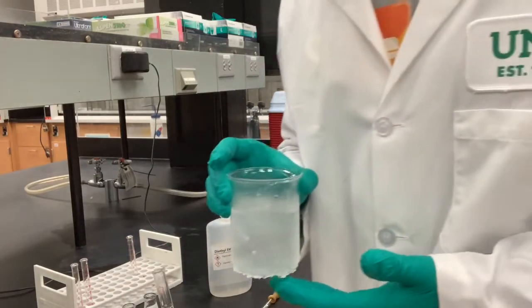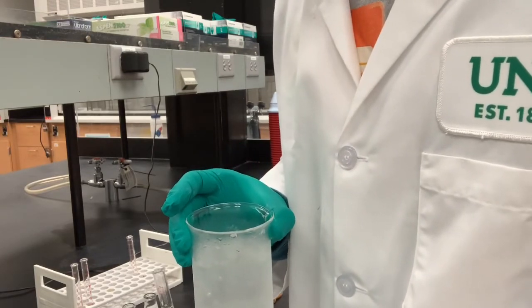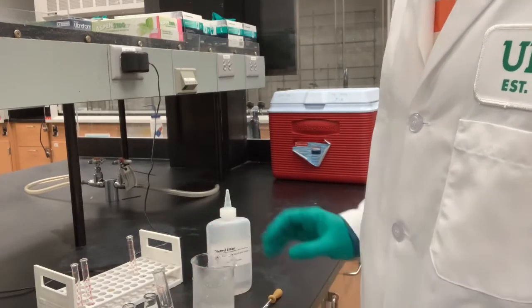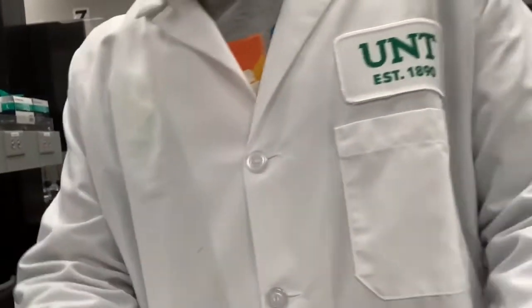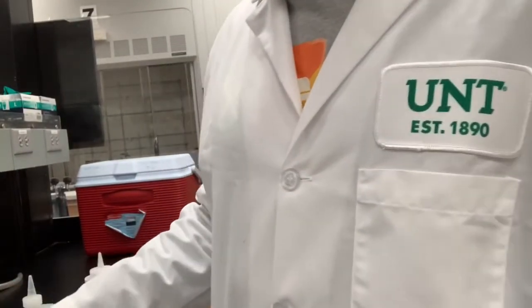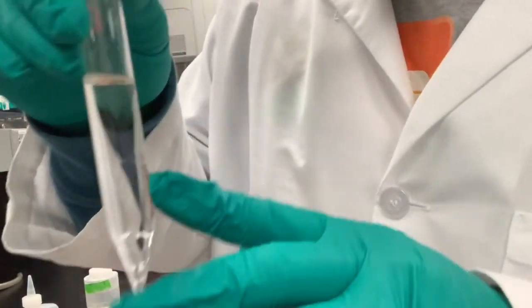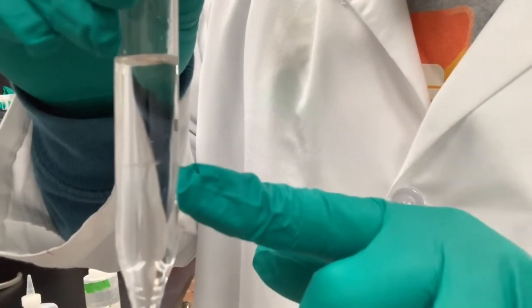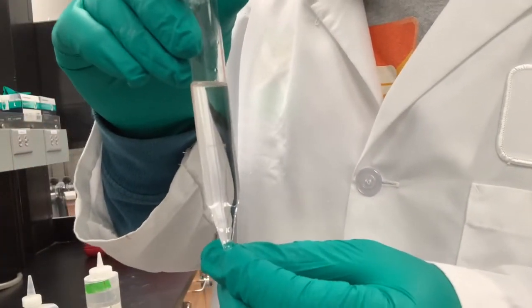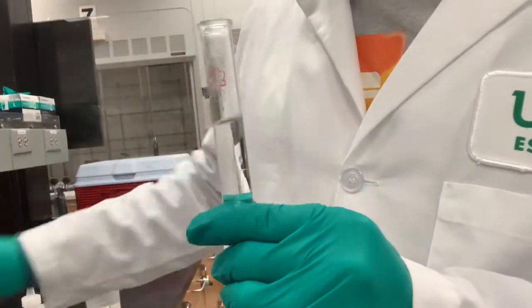Okay, so I have prepared an ice bath for preparation of step 6. Hey guys, so I just let the 2 layers separate as required in step 5. So here you can see that now there is a clearly distinct line. So the next thing I need to do is to pipette out the bottom layer and place it into Erlenmeyer flask number 1.